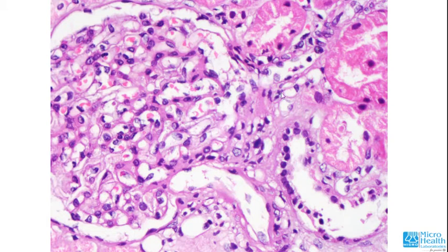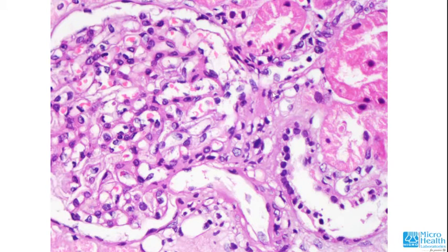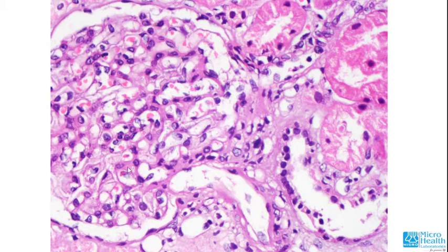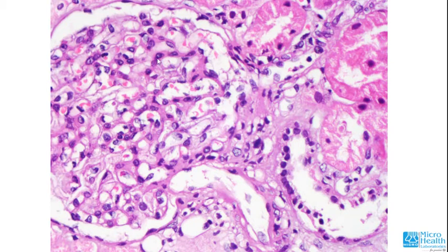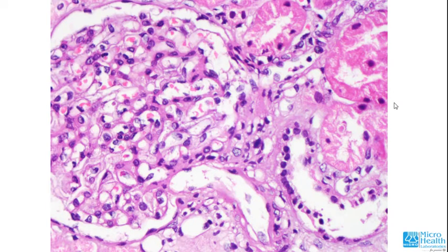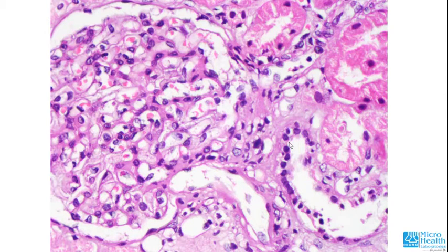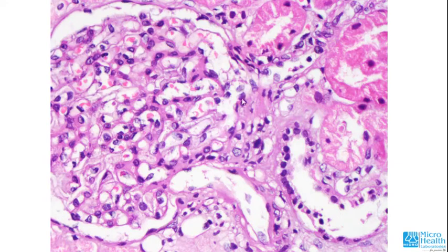This appears to be the afferent arteriole for two reasons: the media is thicker with more cell layers compared to the other arteriole, and the afferent arteriole does not extend much into the glomerular tuft — it divides into capillary loops just after entering the Bowman's capsule. These capillary loops, supported by mesangial cells, coalesce to form the efferent arteriole. An interesting structure visible here is the distal convoluted tubule meeting the glomerular tuft — this is the macula densa.